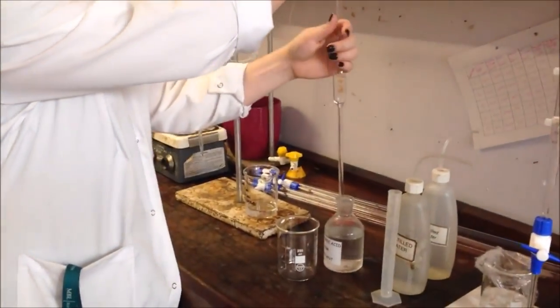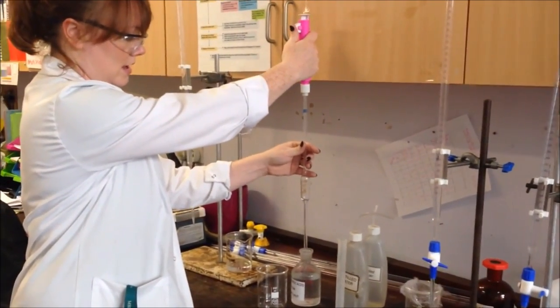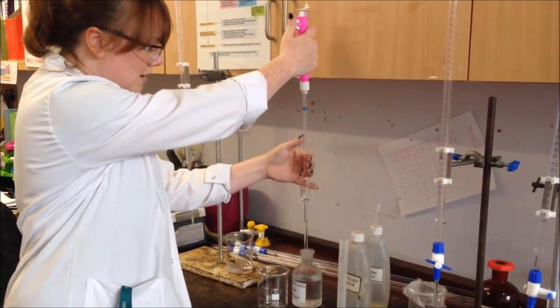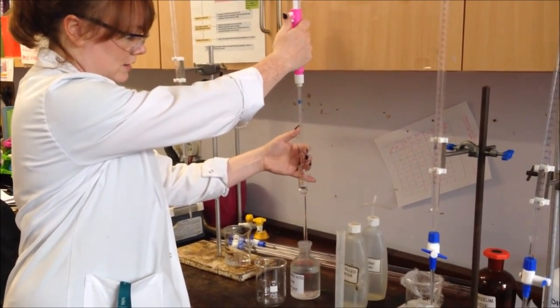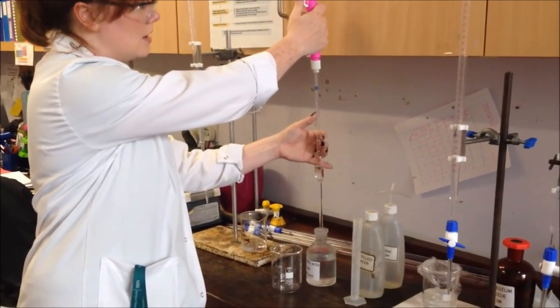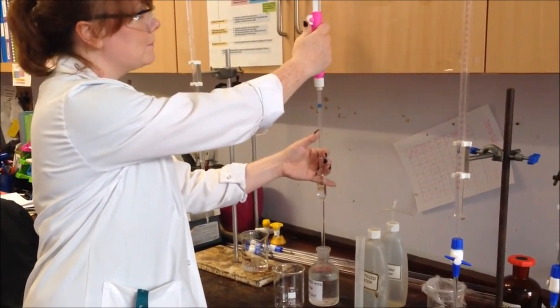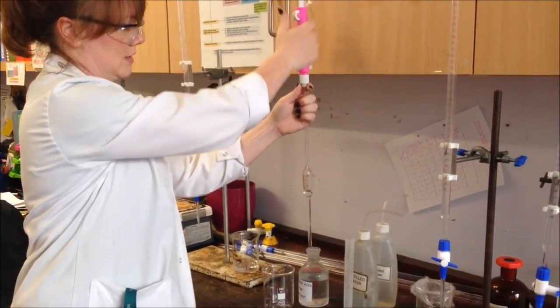I need 25cm³ of this. I've got one hand on my pipette, the other hand on my pipette filler up here, and I'm going to slowly run this up. There is a line on the pipette filler just here that I need to get to. This bit, the middle bulb, takes quite a long time to fill up, but once it gets to the top, it will start filling up rather quickly.